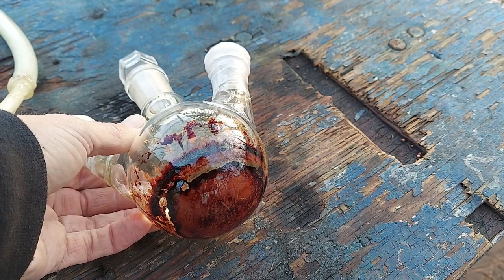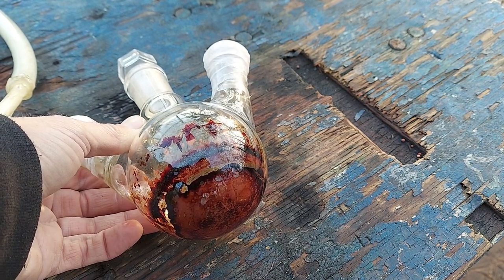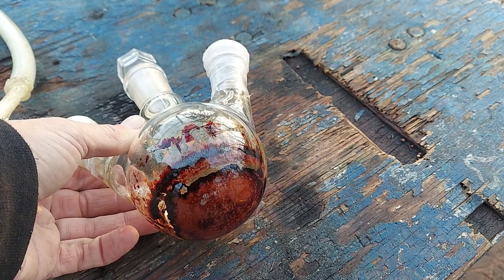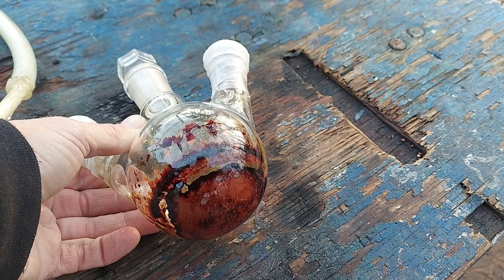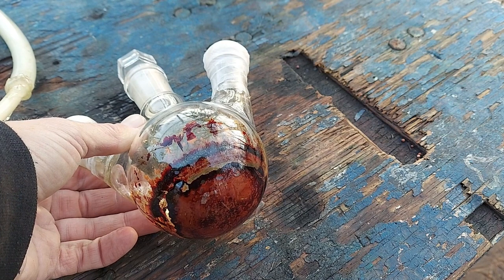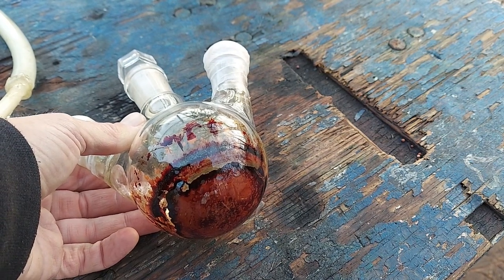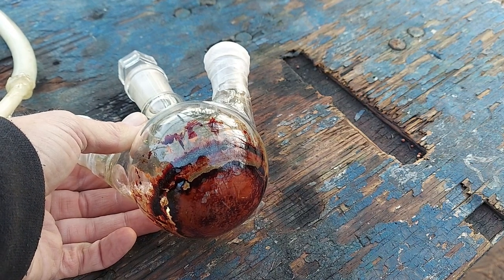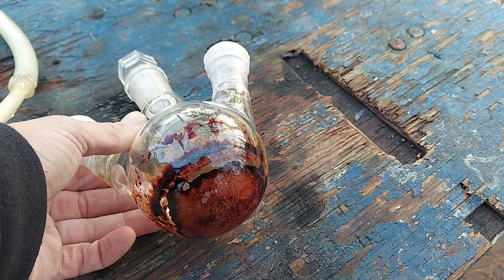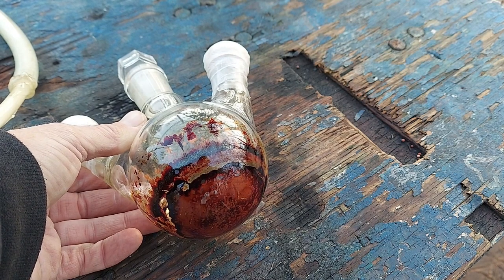Clearly, with my setup here, it's not going to be 100% anhydrous. I'm beginning to think that is just impossible for me to achieve. This is some difficult chemistry and I'm trying to do it in my backyard on an absolutely minimal budget. So we've got to take what we can get. Nevertheless, it does demonstrate that you can make the trivalent salt in THF and it looks like you can do it kind of easily — we'll see what kind of yield we get.